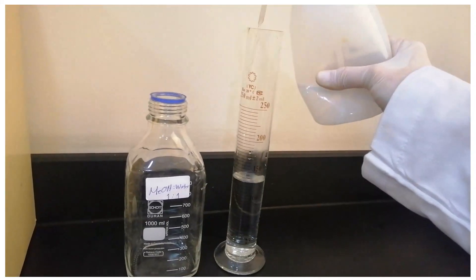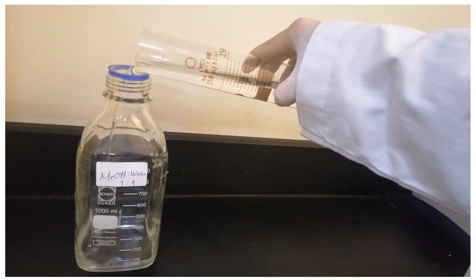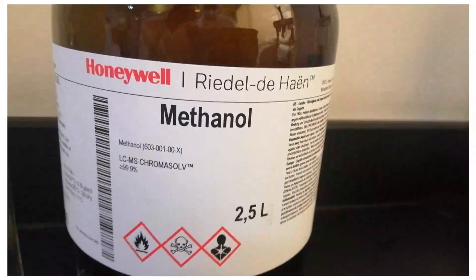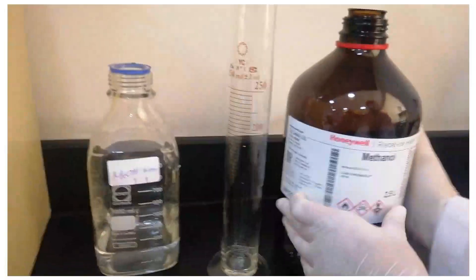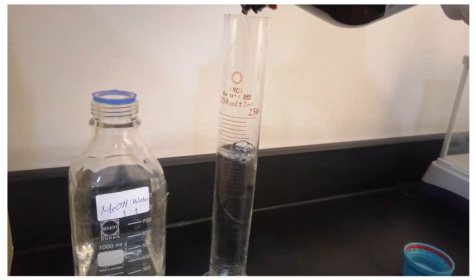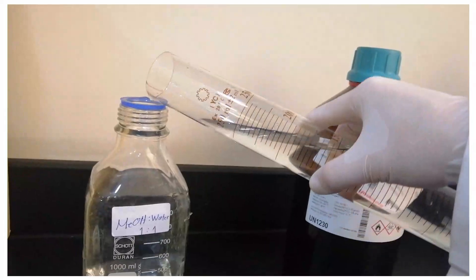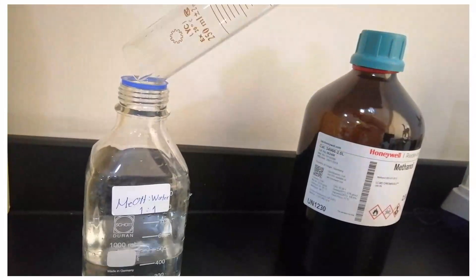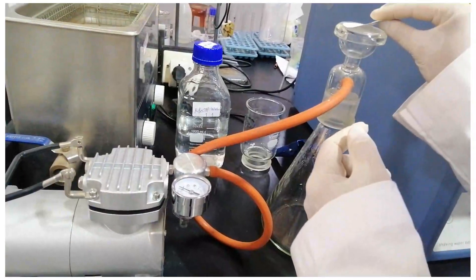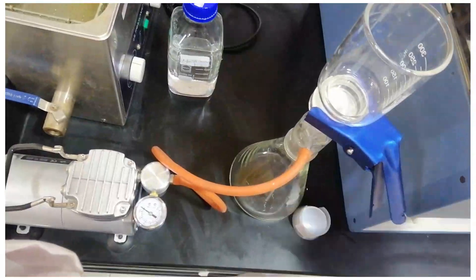First, to prepare the mobile phase, add 200 ml of methanol to 200 ml of purified deionized water. Filter the mobile phase through a 0.45 μm membrane filter under vacuum to de-gas the solution and remove solids that could plug the column. It is important to de-gas the solution, as bubbles can cause voids in the stationary phase or work their way to the detector cell and cause instability in measurements.